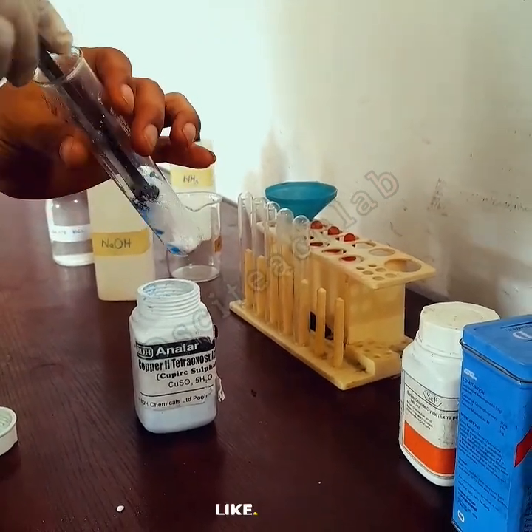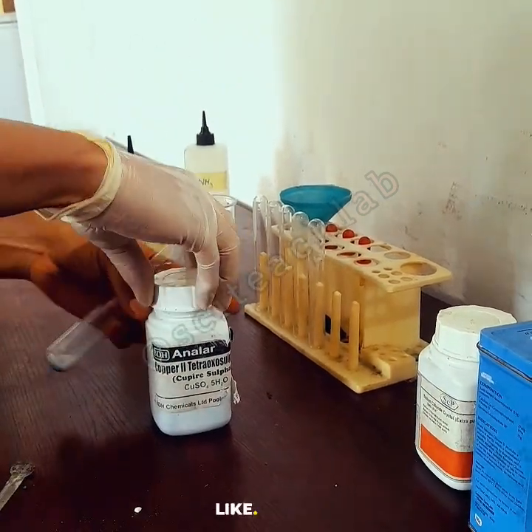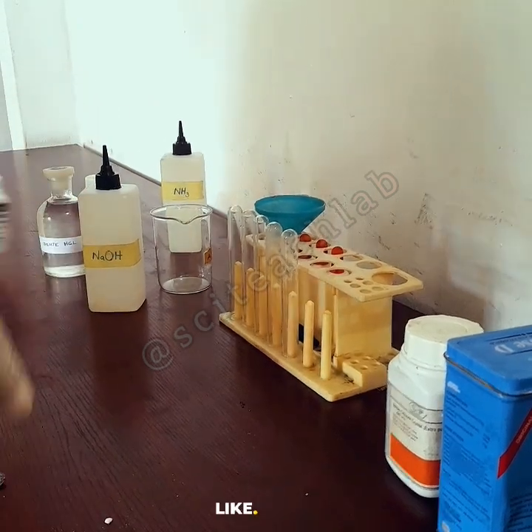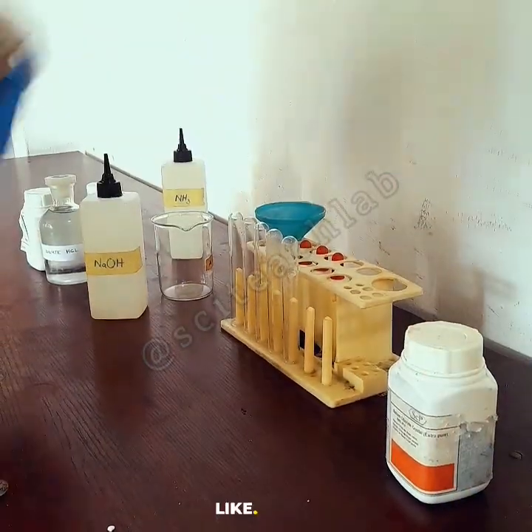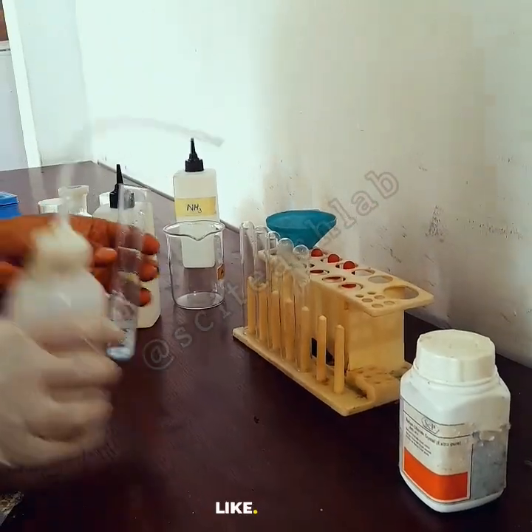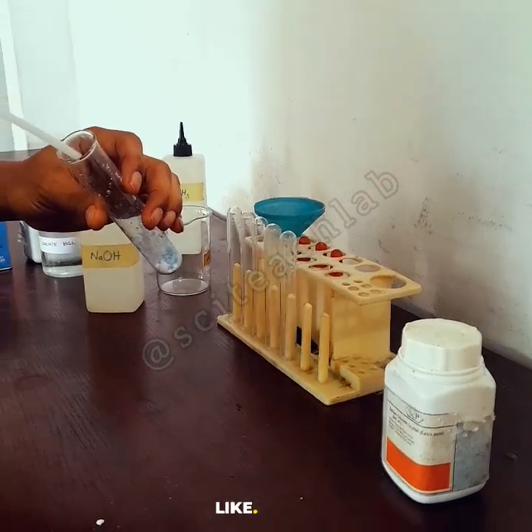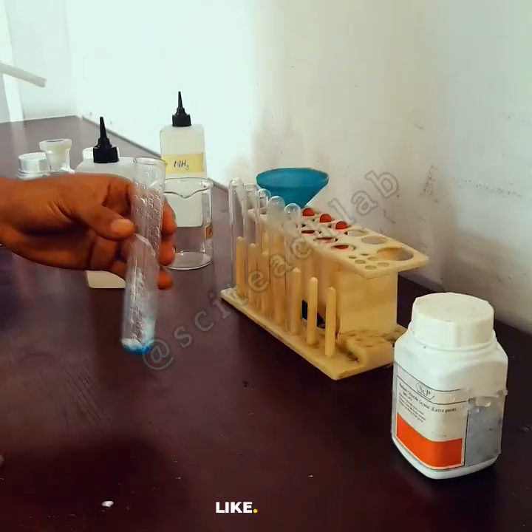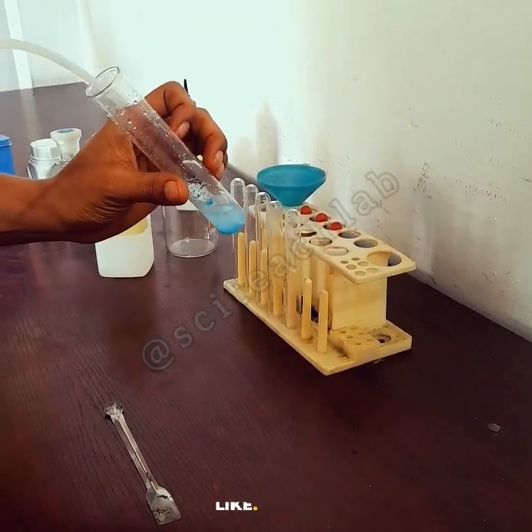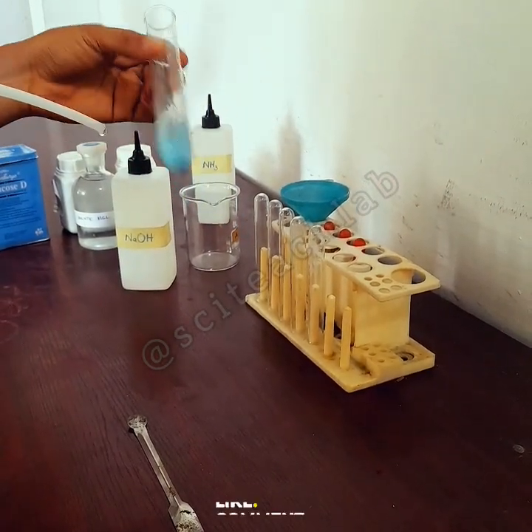So here I add my copper sulfate. The blue color of the salt gives you a hint that the salt might be copper, because copper salts are blue in color. So if in your exams you see a bluish mixture, your mind is already telling you that maybe copper is present in that solution. So I add water to dissolve the mixture so that it becomes a solution, because we're going to use those solutions to carry out the test.